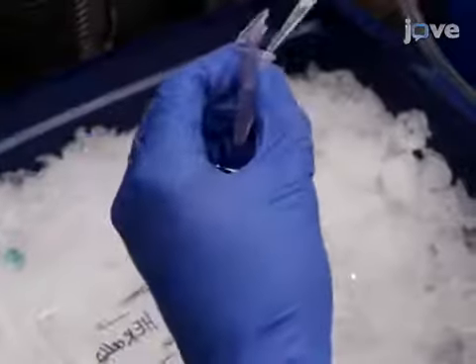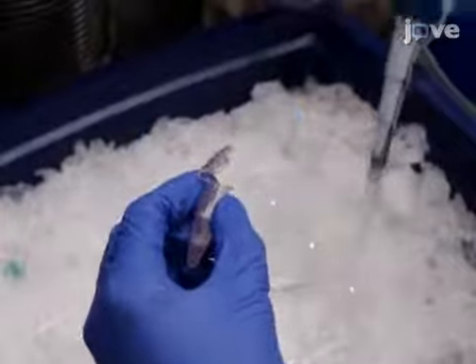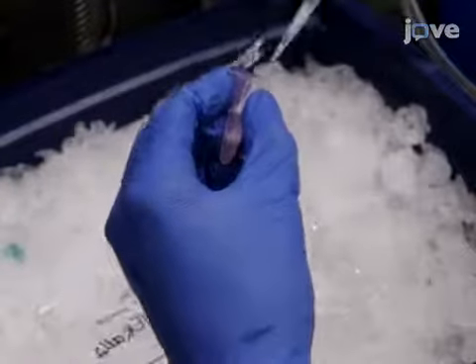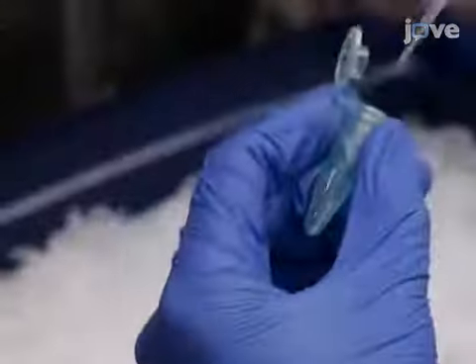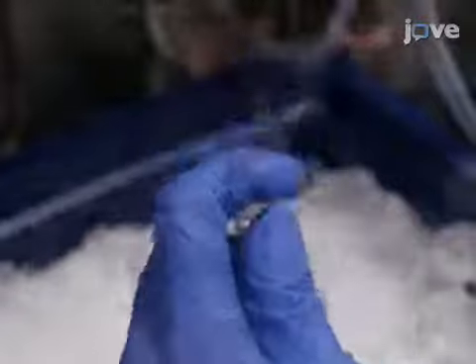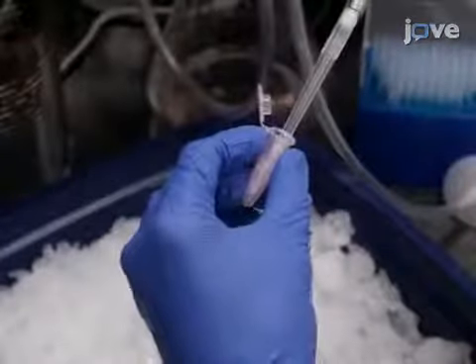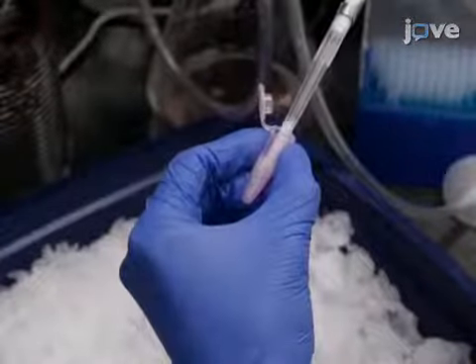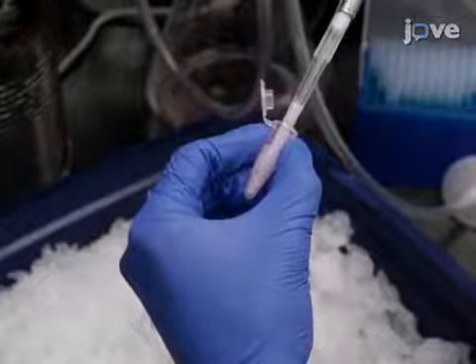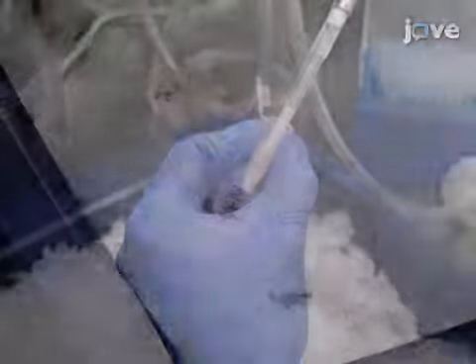Next, transfer the homogenized solution to a pre-cooled 1.6-milliliter microfuge tube on ice, and add 20% Triton X100 to reach a final concentration of 1%. Then with a 1000-microliter pipette, triturate the mixture 10 times while minimizing bubbles. Incubate the tubes on ice for 2 minutes to solubilize the protein.